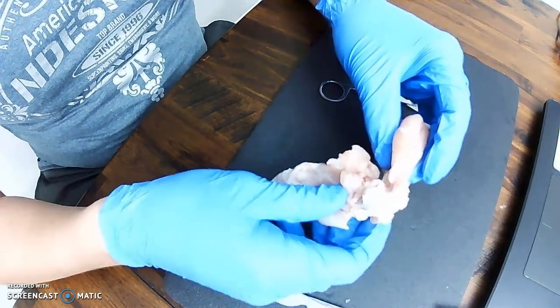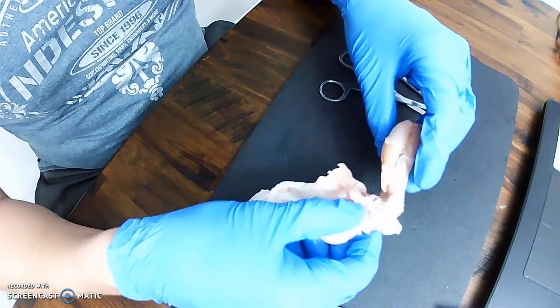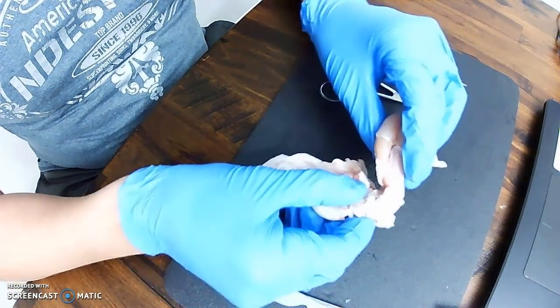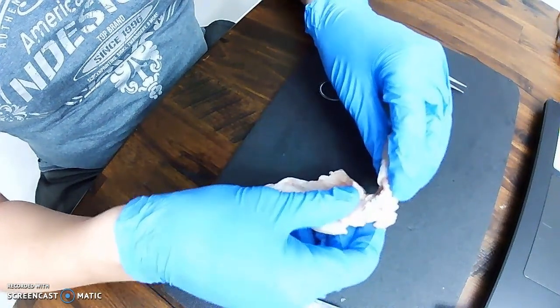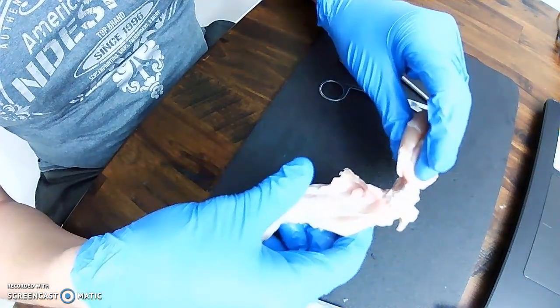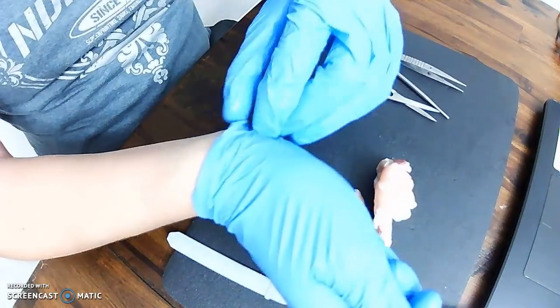That is at the end of the long bones, and what that does is it helps for the bones to slide more easily across each other without any resistance. The synovial fluid also helps as a lubricant during that same process when the joint is flexing, extending, rotating, and so forth. Okay, let me take off my gloves.